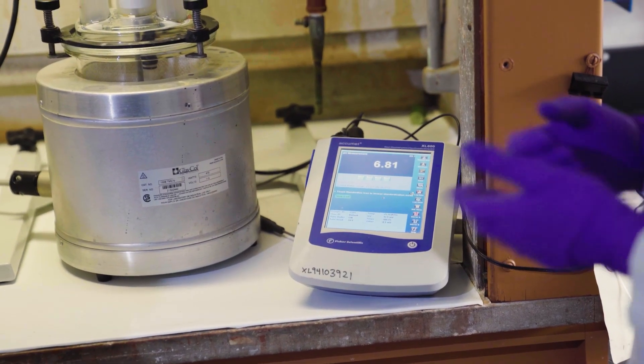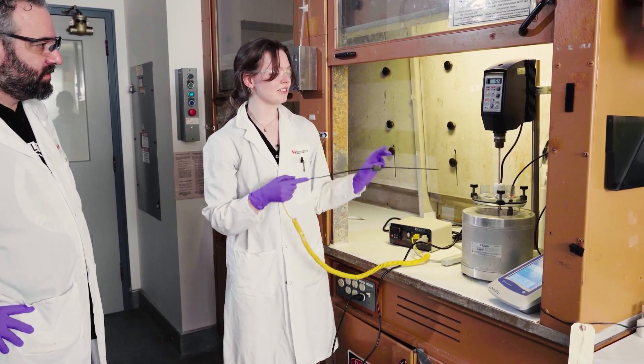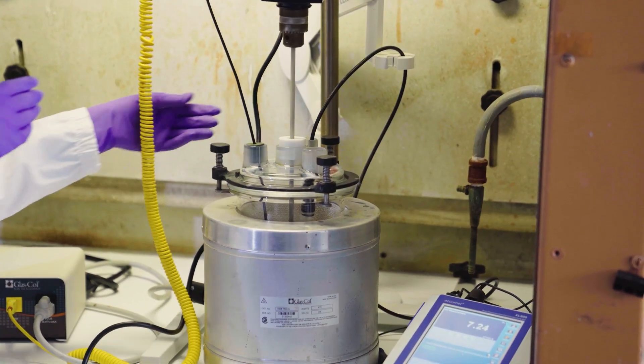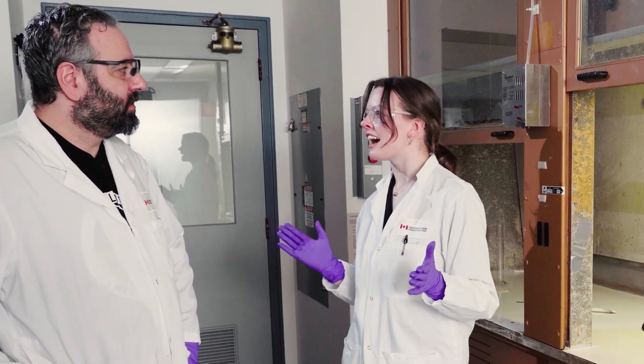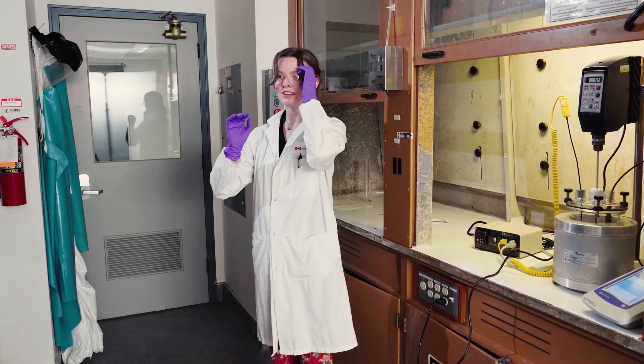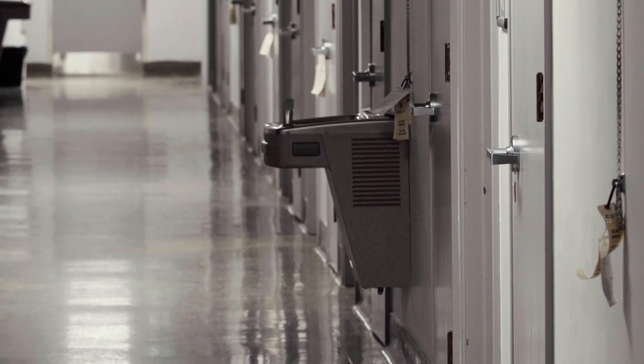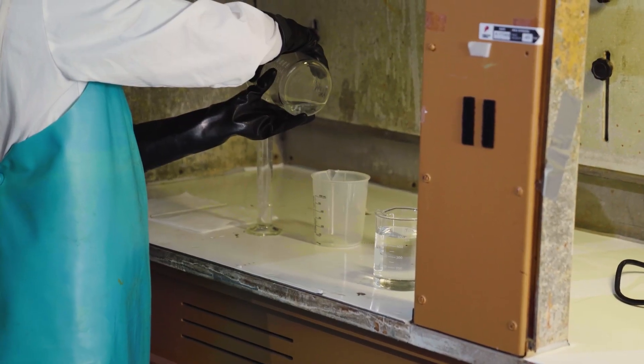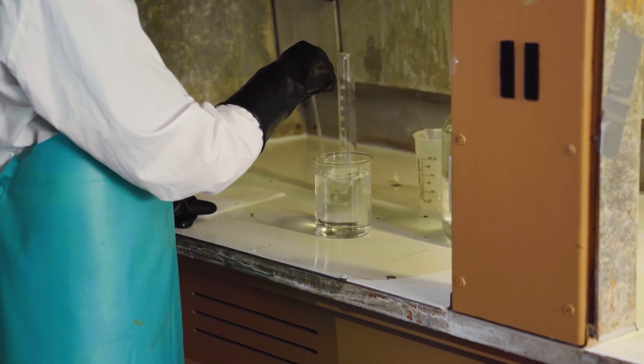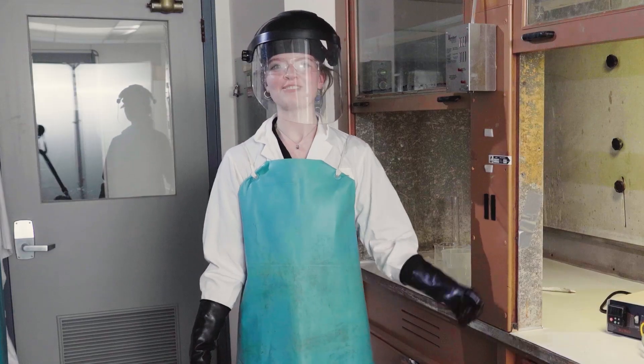Okay. Now she's mixing. It's at a pH of about 6, which is what we'd expect. Then you want to insert the thermocouple, which is part of the heating mantle set up because it measures the temperature inside the liquid. We're missing one magic ingredient. Okay. We need the deionized dihydrogen monoxide. Got it. Perfect. What he doesn't know is that he's looking for water right now because we can't trust him around dangerous chemicals like that. It might actually be my favorite part of the process. We're making like soluble salt. It's protonating the minerals so that they can go into solution and then we can filter them out. And they go into the leachate carbonates, calcites. They are the kind of minerals that they're going to dissolve.